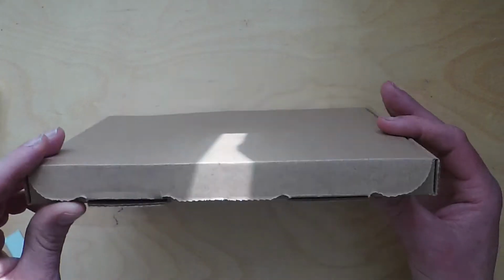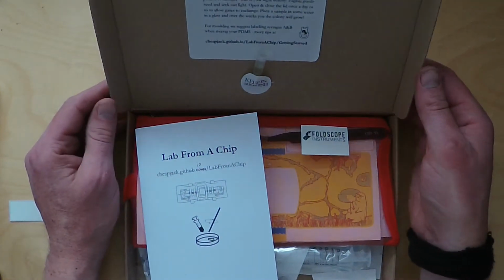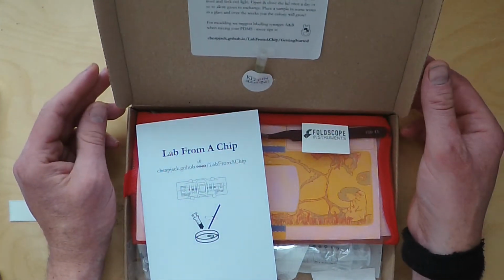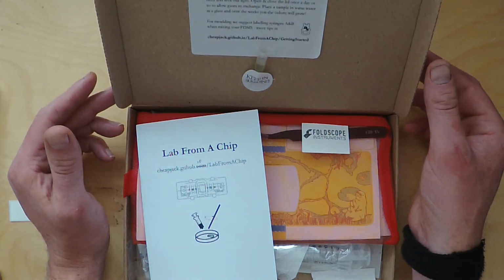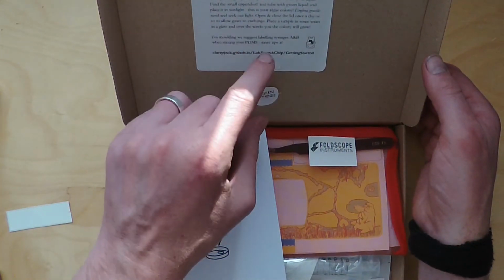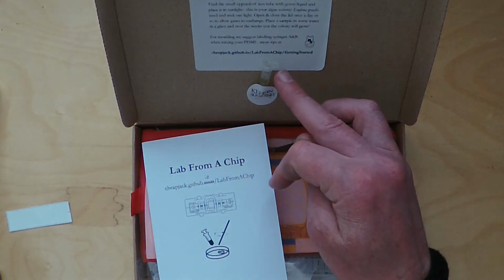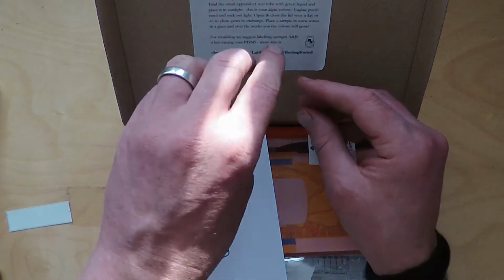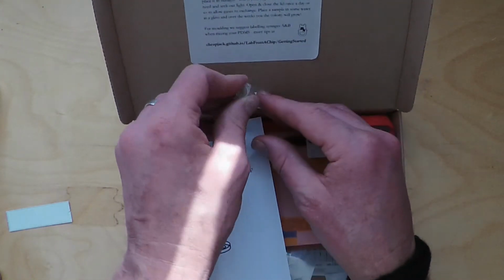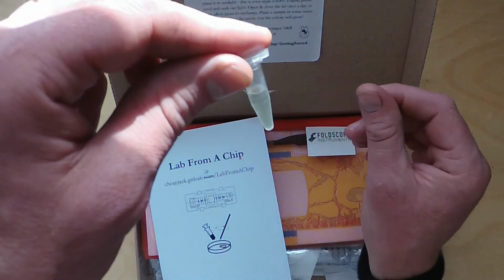So once you've received your kit, you just unseal it, and I'll go through some of the things you get inside it. There's a little sticker on the front that encourages you to open it immediately, and when you open it up there's a little test tube with a sticker saying keep in the sunshine. Inside this little test tube, which has a little clip lid, just peel off the sticker, and you've got our little algal suspension.